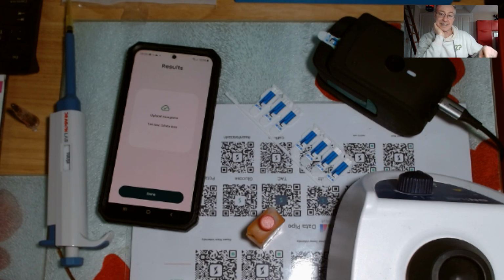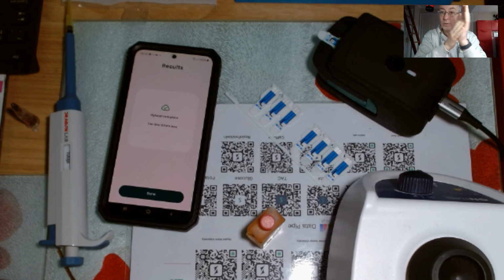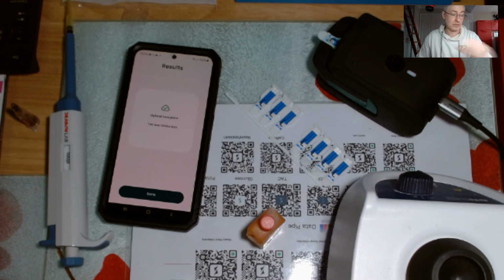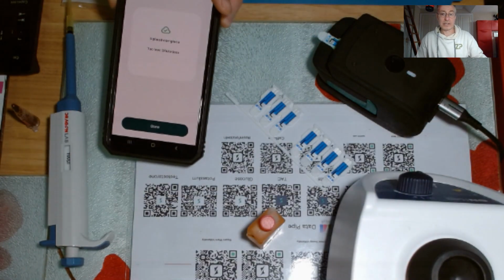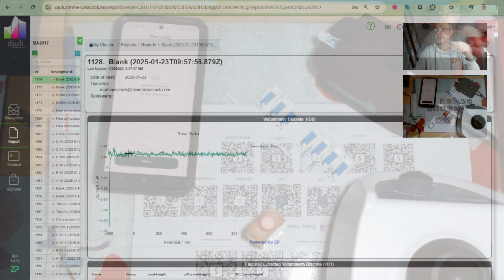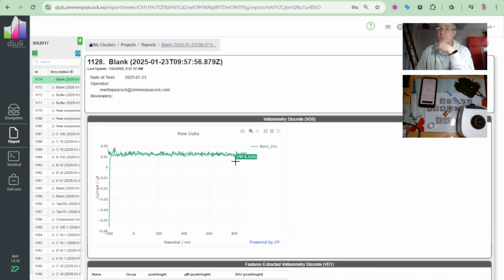I didn't click that into place. So I'll click it down, I'll click it up. That is not the root cause of this particular person's problem. But if you get an error message like that, I would quickly go up and check, because if your data is looking like this, then essentially you didn't close the device, and there wasn't an electrical connection, so it hasn't analyzed anything. But I fixed that problem now, so that's not the problem this time.